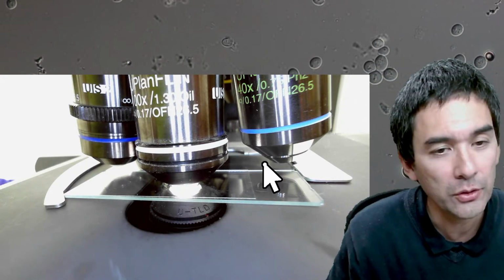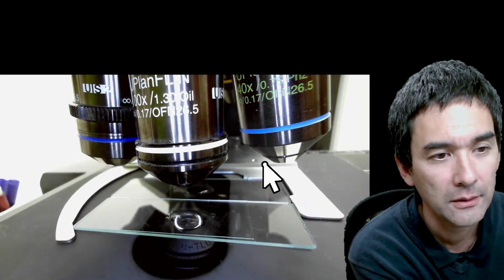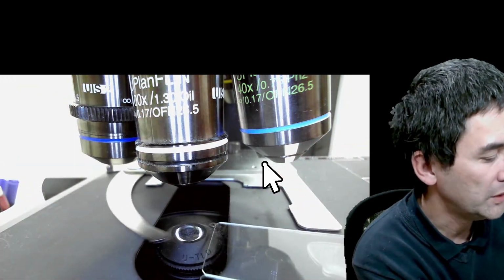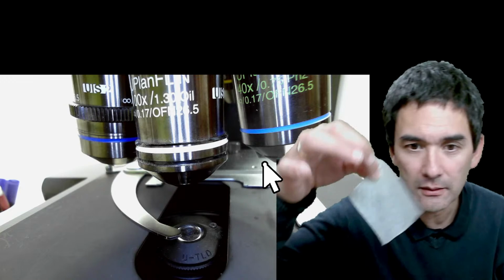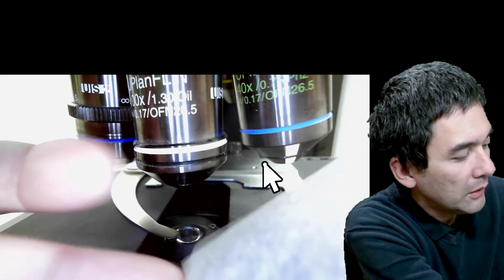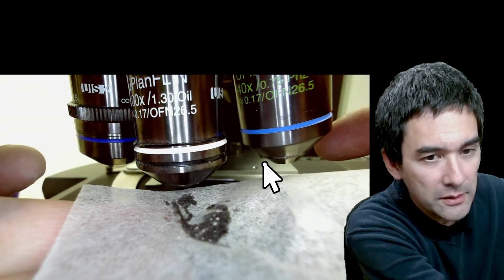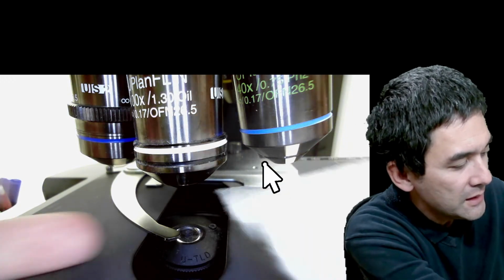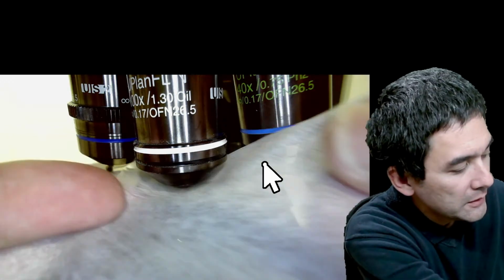So I'm going to clean this. I'm going to lower this again. I'm going to turn off the light. It's kind of blinding a little bit. I remove this, both of them, because I do not want to have any oil anywhere. And then what I do is I take a lens paper, and all I do is very lightly wipe. You see that's all of the oil, right? And then of course you have to be careful that you still don't contaminate the other lenses. Just carefully wipe it off, maybe go like this a little bit.